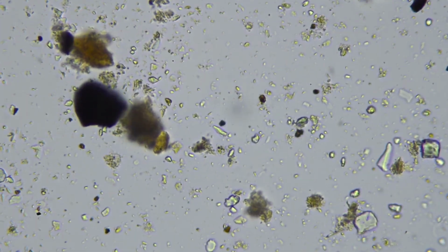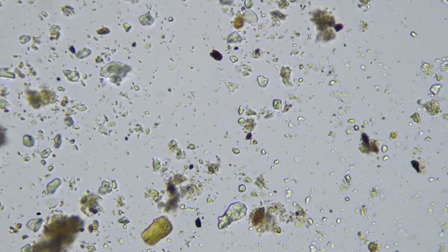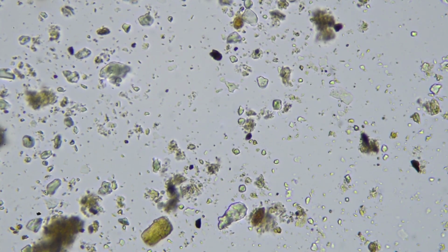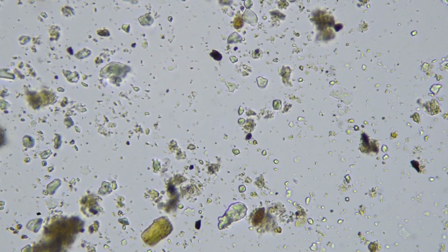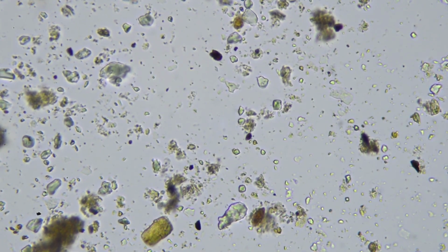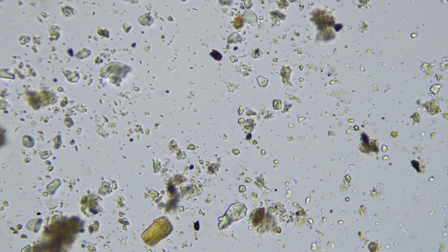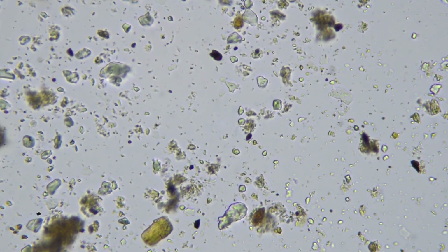So yeah, what we're looking for is fungi. We're wanting to see maybe one per, maybe two fields of view. There's this correlation that I briefly mentioned where if you can get your fungal to bacterial ratio sympathetic with where your crop species is in succession, or its wild relative would be in the wild, that's when we get the real gains in terms of yield, nutritional complexity, disease resistance, drought resistance.